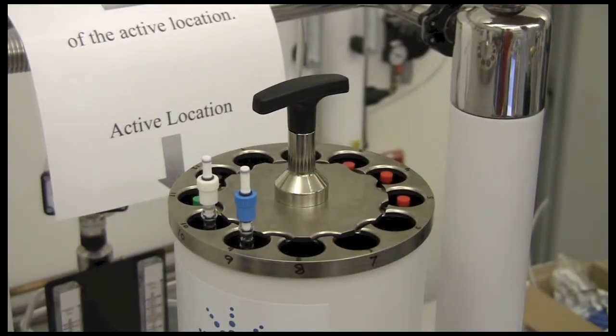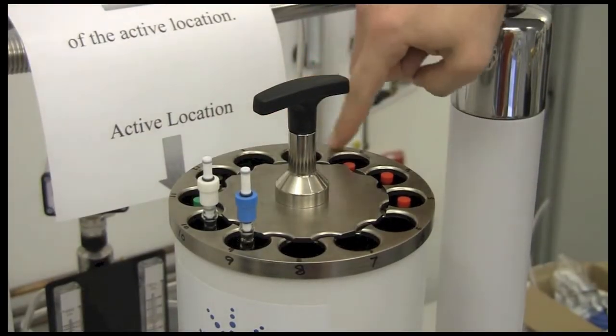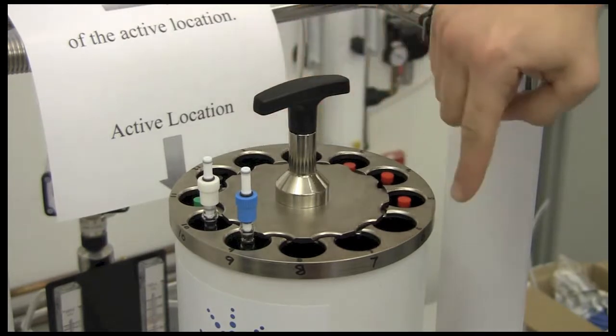Once you get to the top of the sample changer, you should see that there's a number of slots. They're numbered 1 through 12.